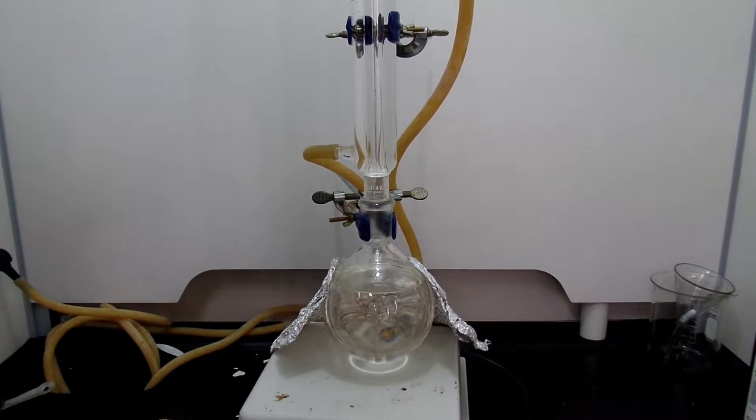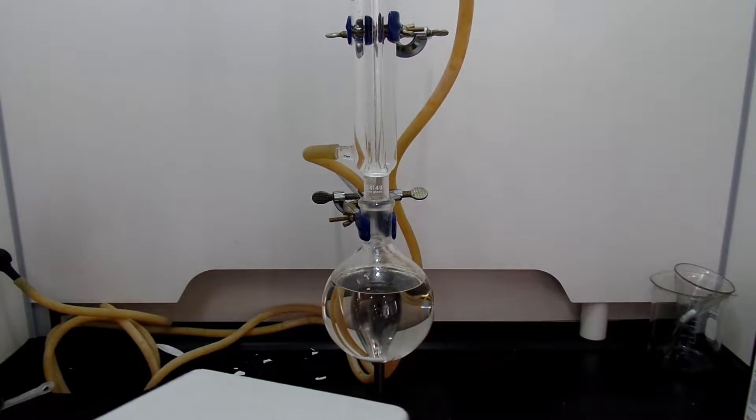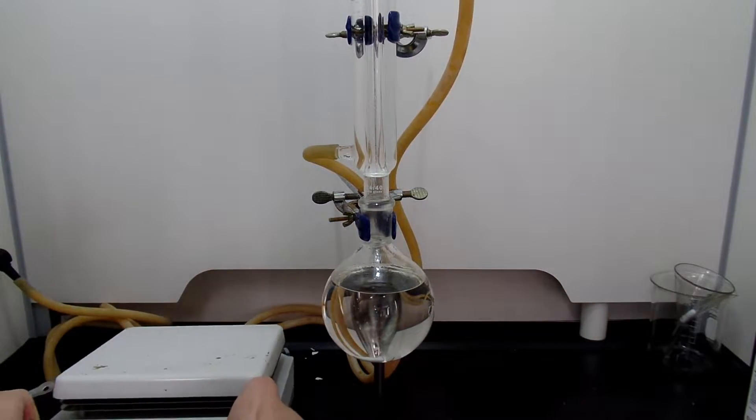Last time, I failed the synthesis of bromoethane and used up all of my precious hydrobromic acid. So I found another approach.